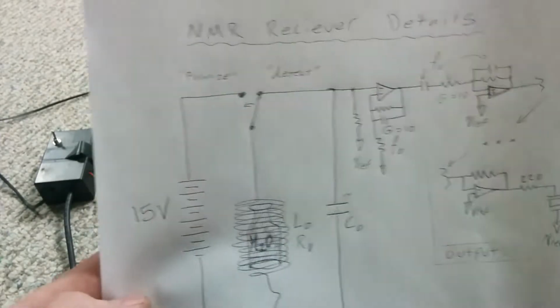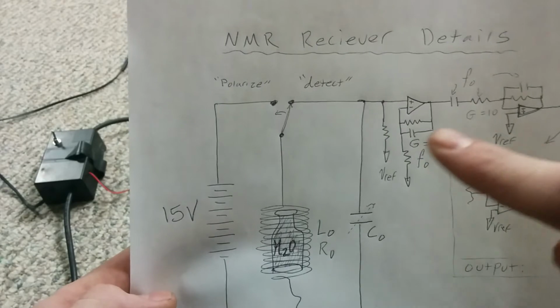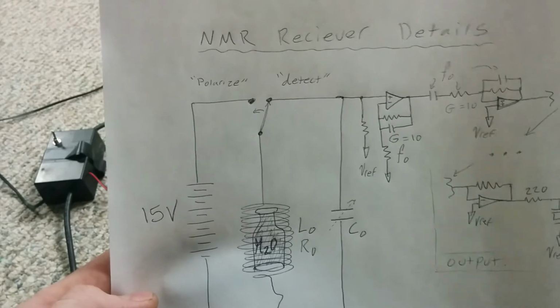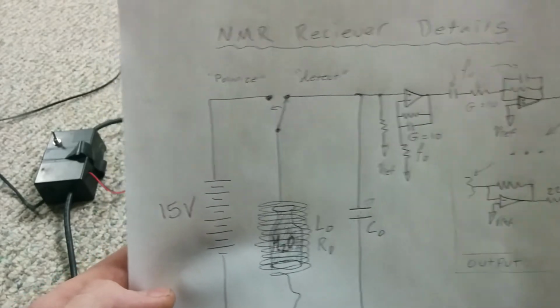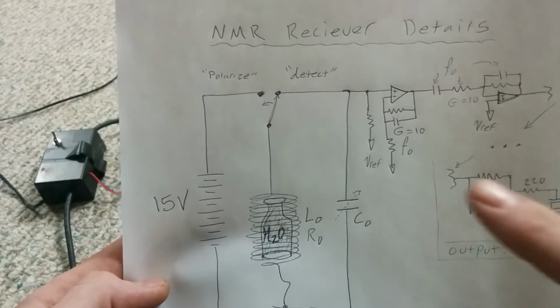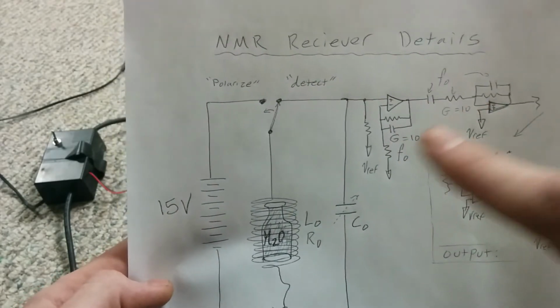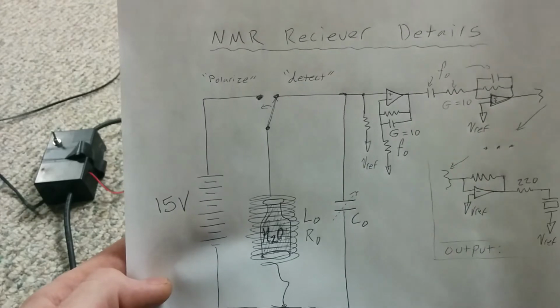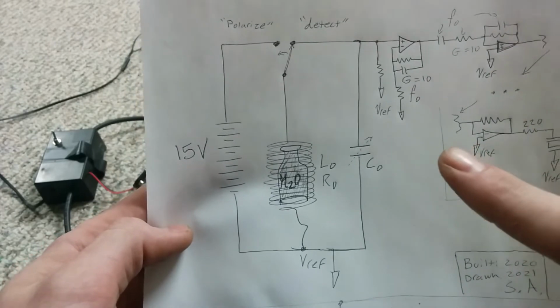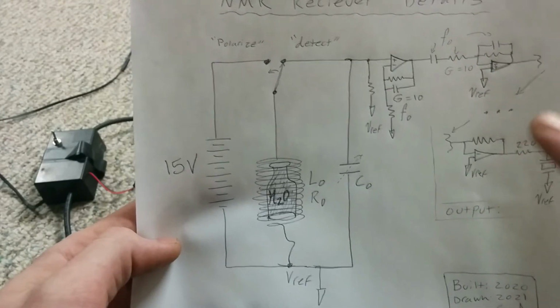If we move into the amplifier here, it's just gain stages. And I've taken advantage of every opportunity to put a corner in at the frequency of interest. And I have the gains here as 10. That's where I started. I had three gain stages. I forget whether it was non-inverting, inverting, non-inverting. I don't know, but it was some mix of inverting and non-inverting gain stages, three of them. And the final one, which I also don't have drawn here very well, was just a unity gain inverting amp. So I could pick the polarity of the output or even use differential.